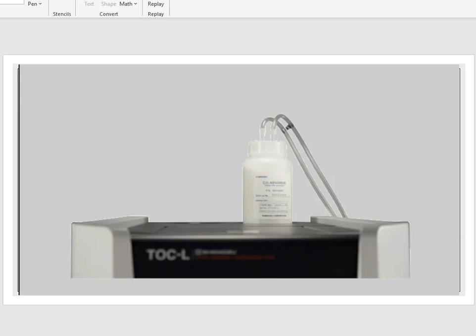These crystals, they're chunks on the inside. Those crystals absorb all the carbon dioxide that's getting produced, and then just normal, clean air, I guess you could say, will leave this bottle and go out of the exhaust of the machine. So that's the purpose of the CO2 absorber. It is a consumable that has to be replaced. It is something that you want to replace on a routine basis. And believe it or not, there's no indicator on these crystals either.